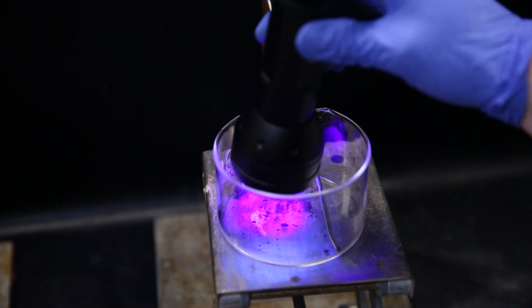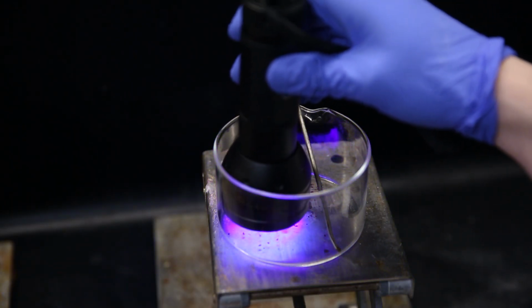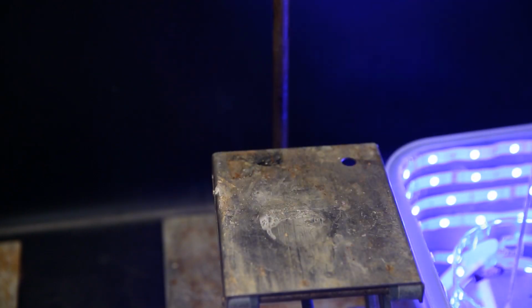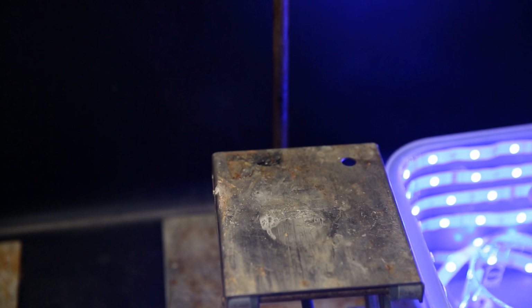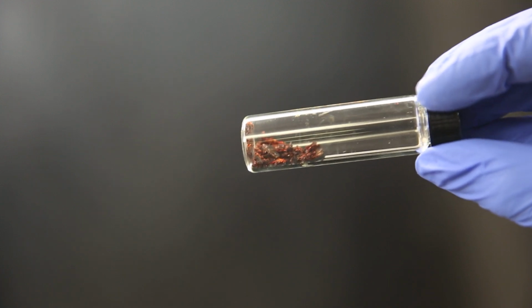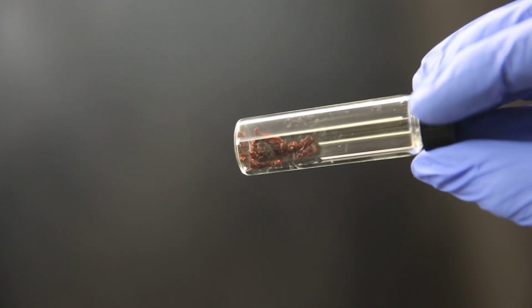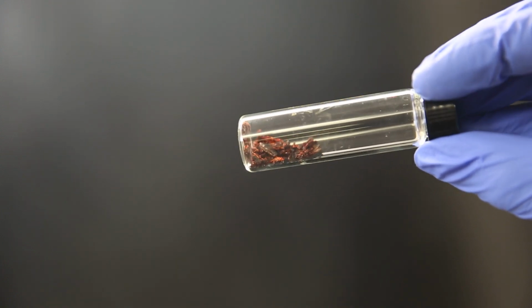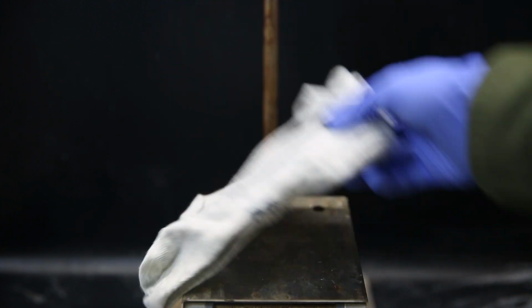Also, I tested to see if this compound is photo-switchable, like many azobenzenes are said to be, but I tried blasting it with a UV light and with visible light, and it didn't seem to change color, so that's unfortunate. I challenge anyone to get a better yield than me, which honestly shouldn't be too hard with the mentioned improvements. But if anyone replicates this, you don't have to make the azo dye, because 2,4,6-trimethylaniline is also useful for making carbenes, which are also fun.